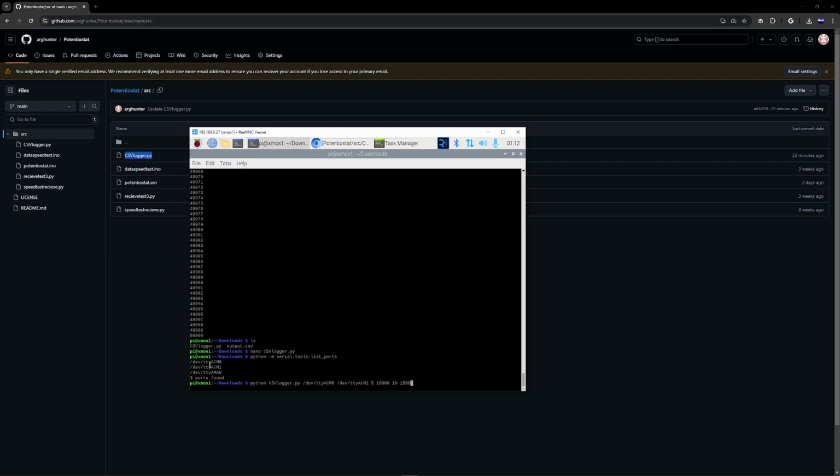Now, to run CSV logger, there are a couple command line arguments. The first is the read port, ACM0. The second is the write port. Then you have the duration of the test. In this case, I'm leaving this 5 seconds. Then after that, the sample rate of the analog pins, which is 10 kilohertz over here. After that, you have the PWM sine wave output. This number is its frequency, and this number is its sample rate.